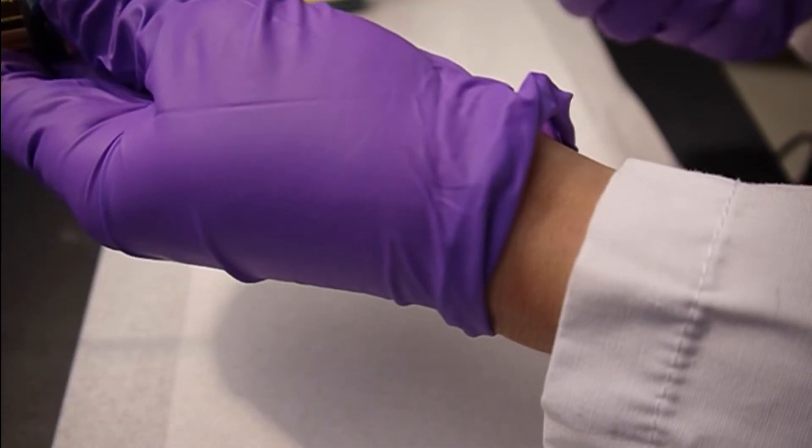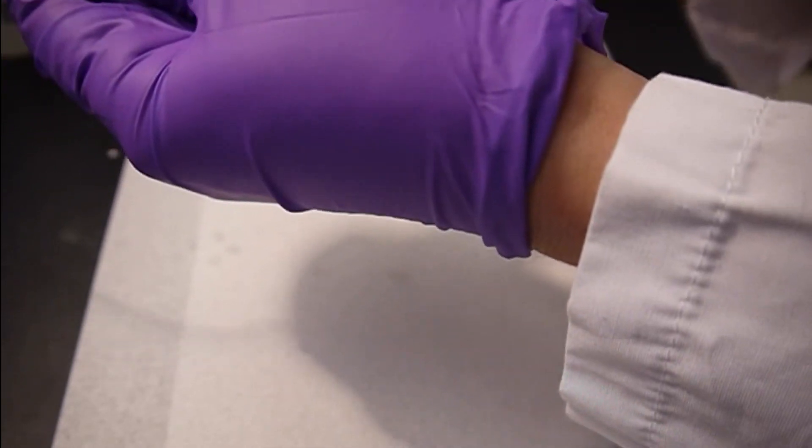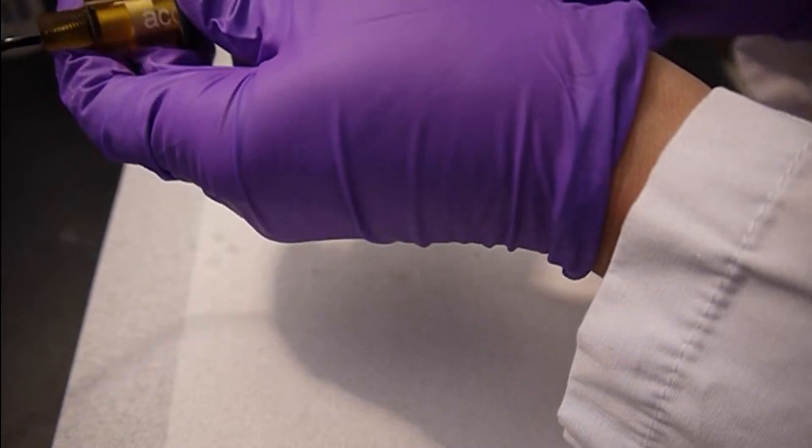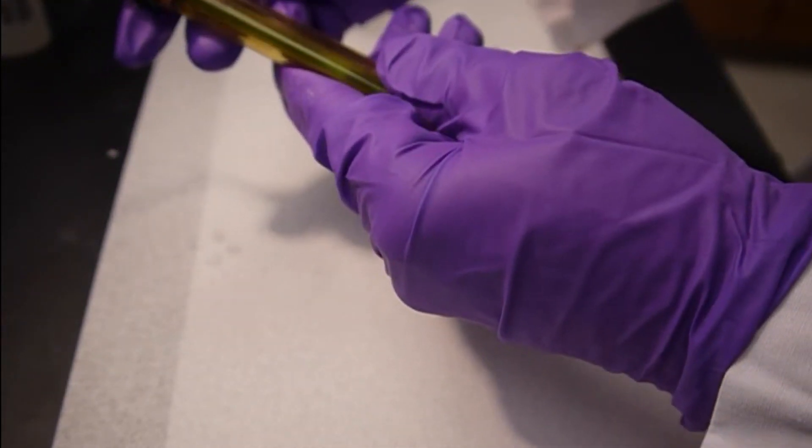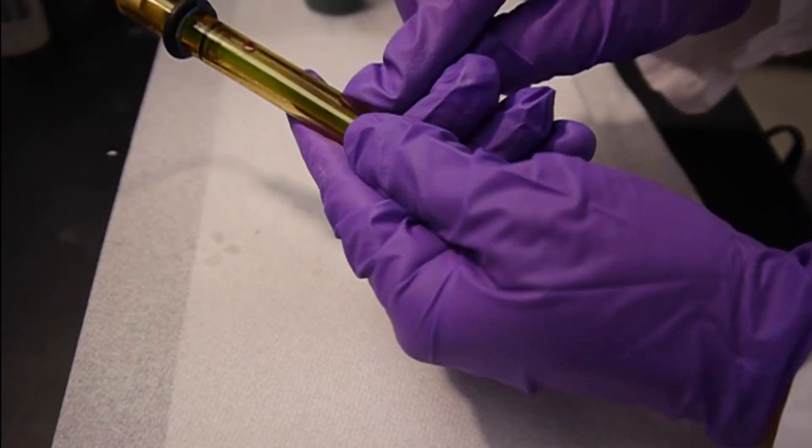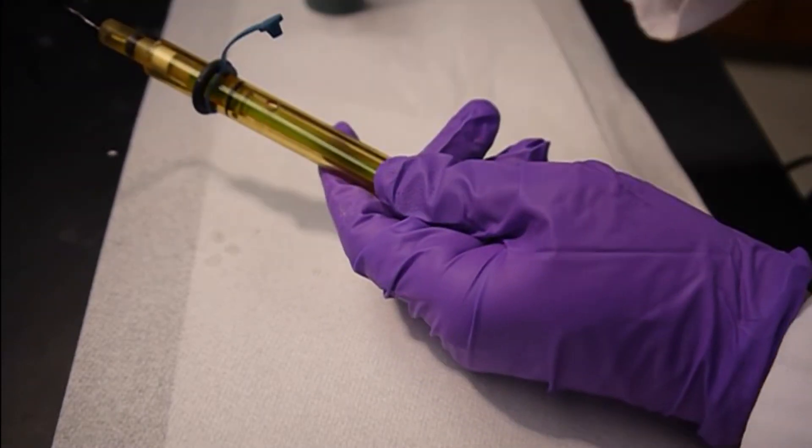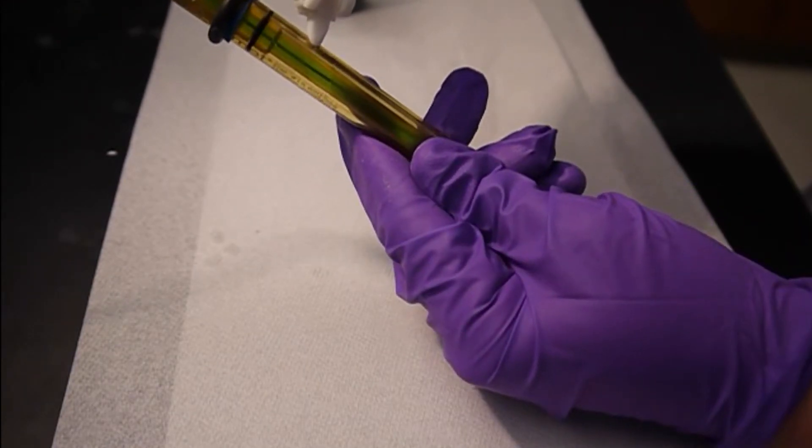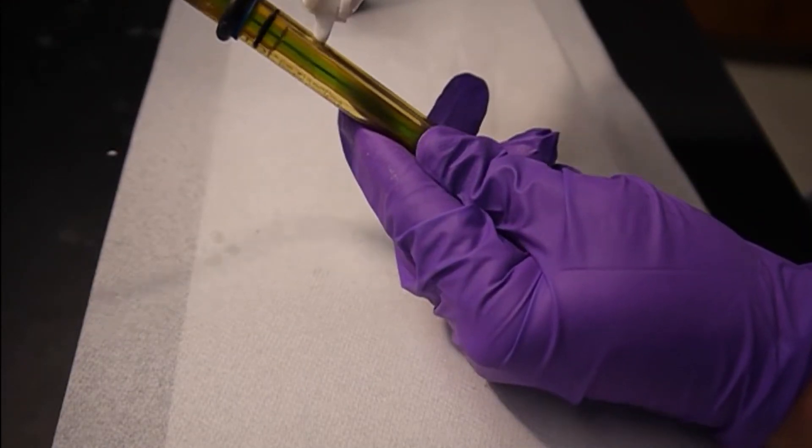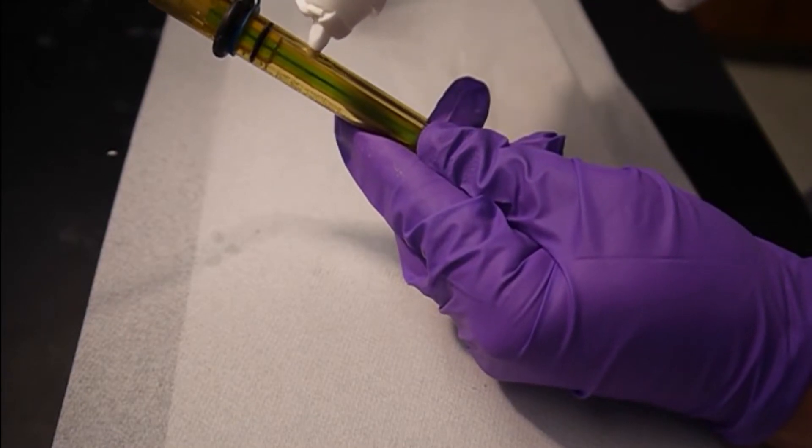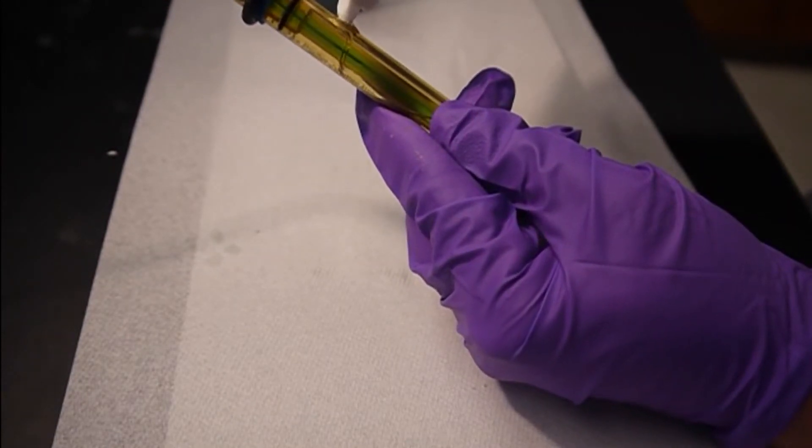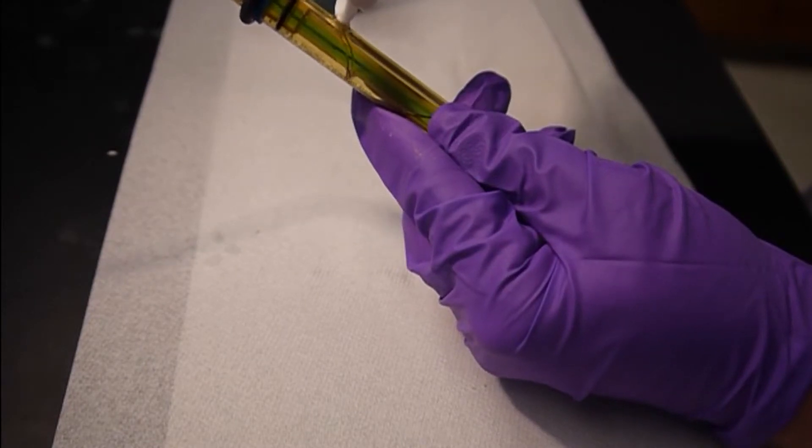Okay, so I'm going to put the inner electrode part into the outer. Okay, and now we need to fill the outer portion of the electrode. Okay, so we're just using this solution. This solution is a potassium nitrate solution.